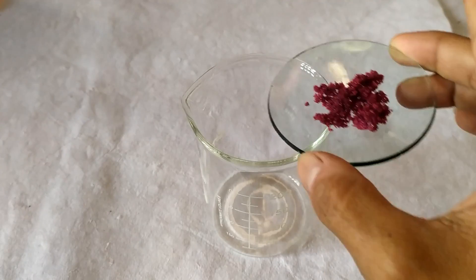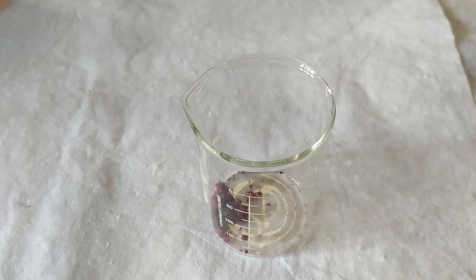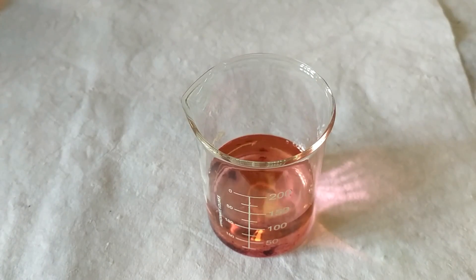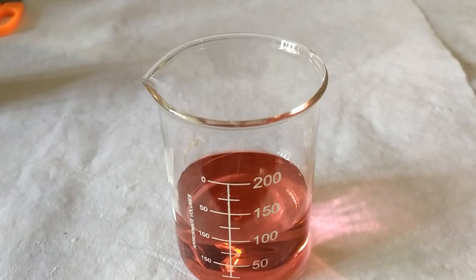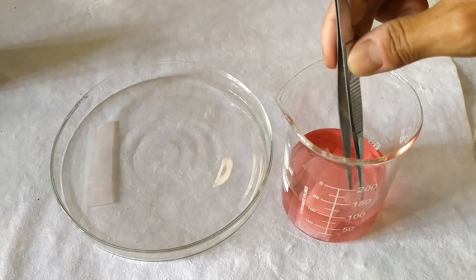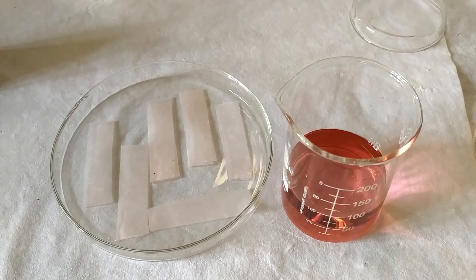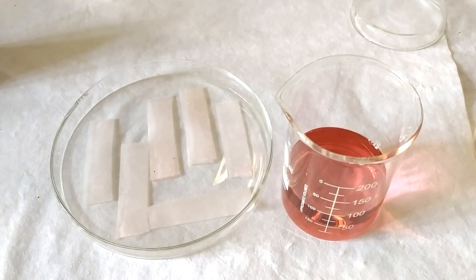To begin the experiment, prepare approximately 3% aqueous solution of cobalt chloride using distilled water. Dip some filter paper strips into the solution for about a minute or so. Remove the filter papers using a pair of tweezers and lay them one by one on a petri plate or a dish. Dry the papers in sunlight or an oven.